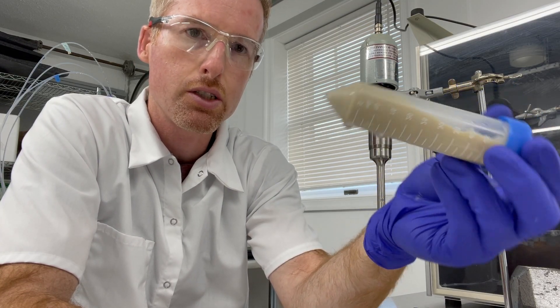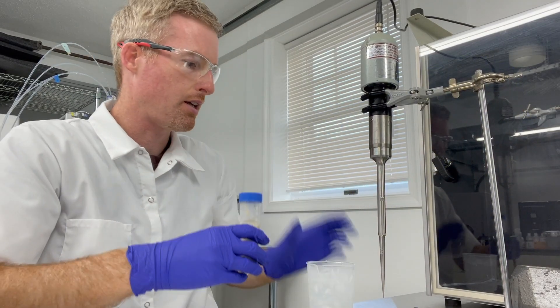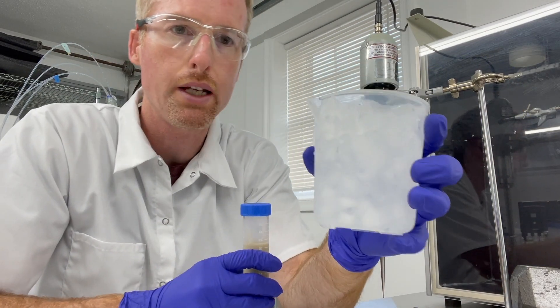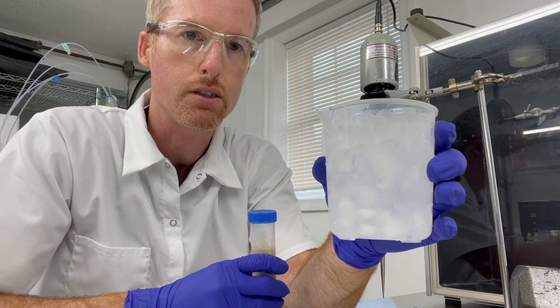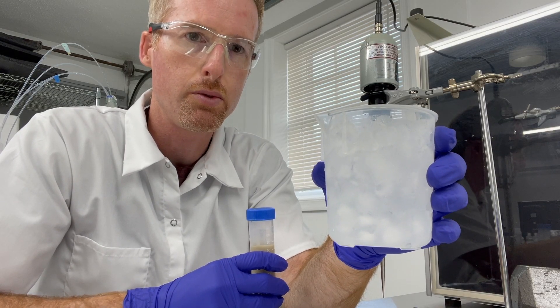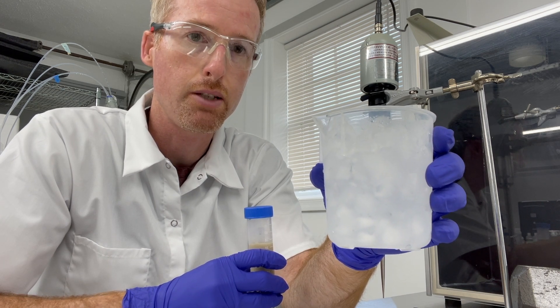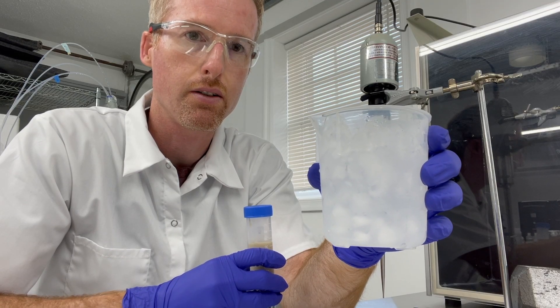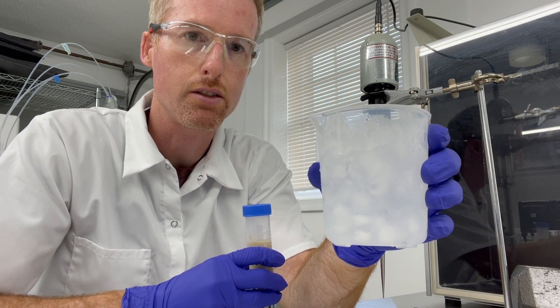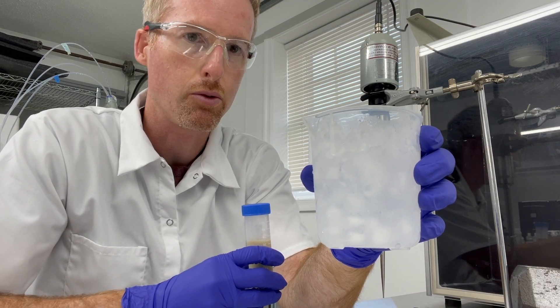About the consistency of a milkshake is good. I've got a beaker of wet ice which is going to serve two purposes: it's going to hold the tube with the cells upright while I sonicate, and it's also going to keep those cells cool, because the sonicator adds a lot of heat to the solution and we don't want to denature our protein that we're purifying.